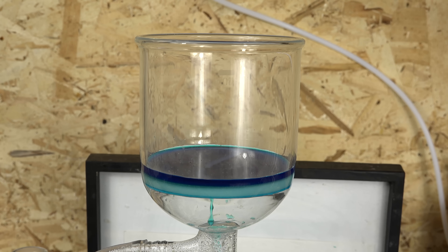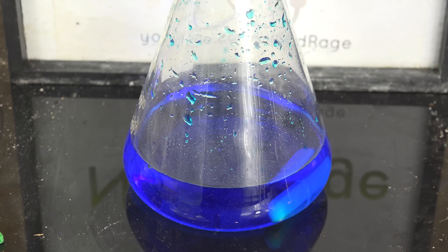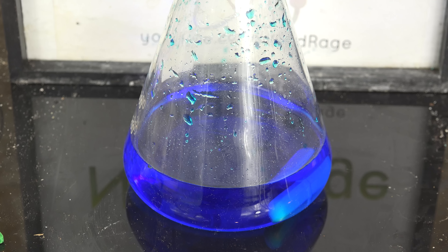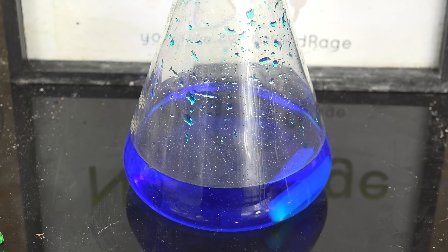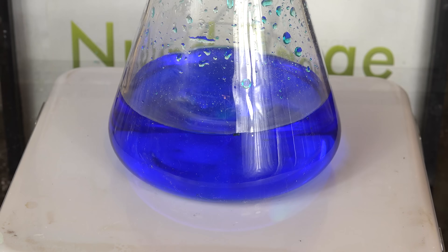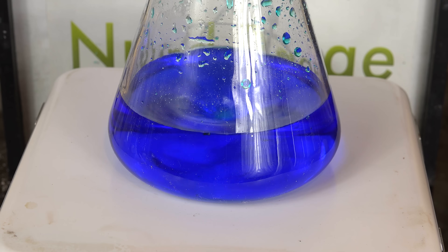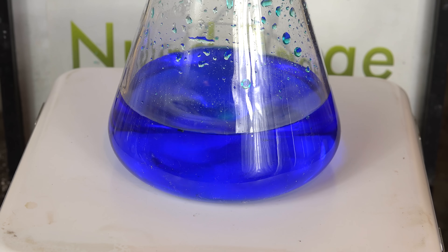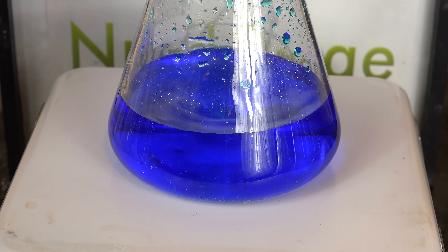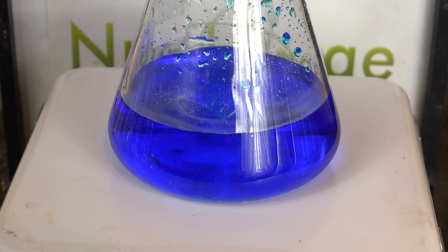Precious metals in solution will contaminate subsequent steps. Anyway, here is our filtered copper nitrate solution. To recover our nitric acid we need to react it with sulfuric acid. And if you know exactly how much copper is in solution you can add a slight stoichiometric excess and be done with it. But I'm going to assume the amount of copper in your solution is variable since it's a waste product of metal refining, or you have sulfuric acid of an unknown concentration, so you don't really know how much to add. Fortunately we can crudely test for our end point.